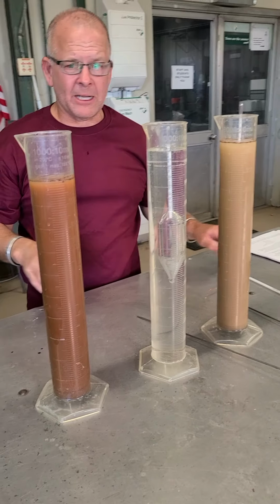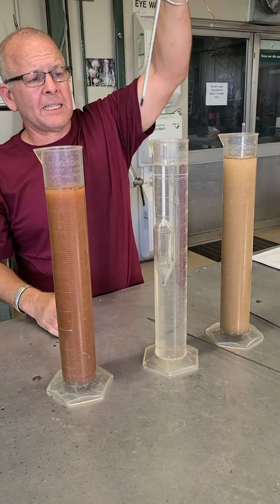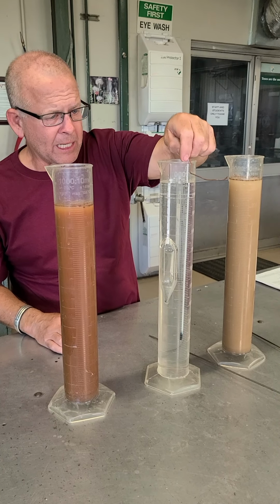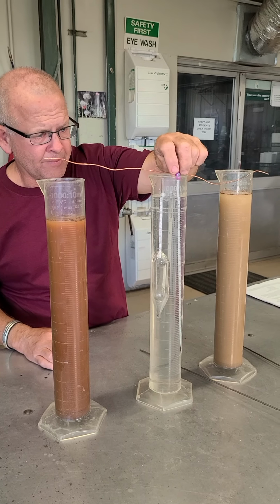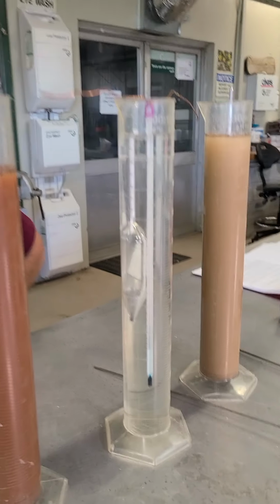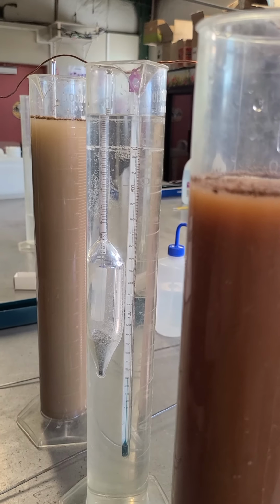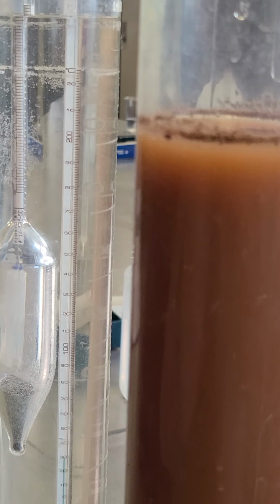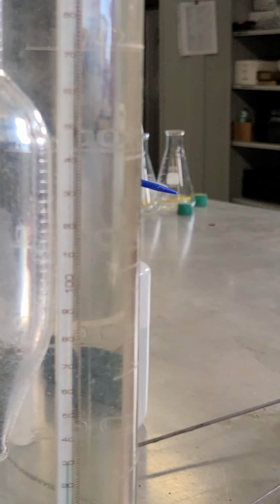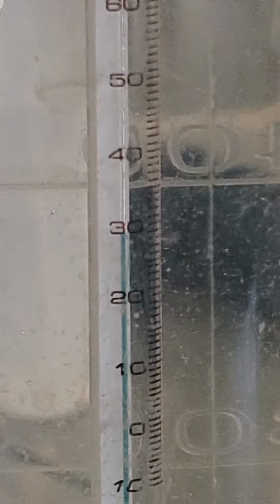Okay, now what else did I tell you? I haven't done this one yet. I'm going to do that one in a second. But I told you that we needed to take the temperature of this soil because the temperature is going to be critical to the density. So I can stick this one in here. Let's see if that's showing up on the camera down there. Maybe on this side you can see it a little better. We'll wait for it a little bit. Right now, as I said, it's relatively warm in here. That's reading about 28.5 degrees Celsius. So we're definitely in a warm lab today.